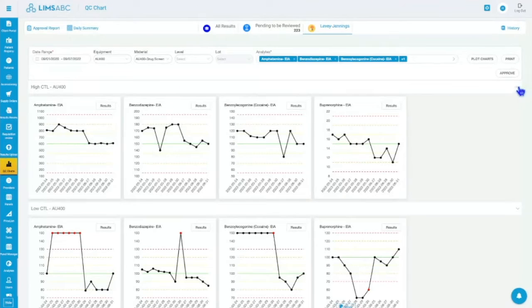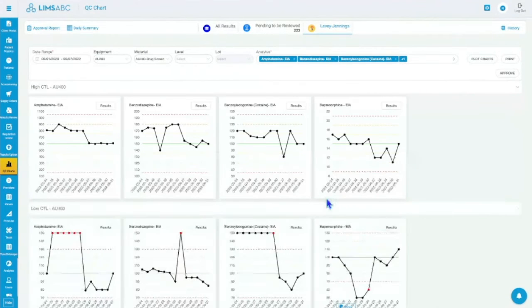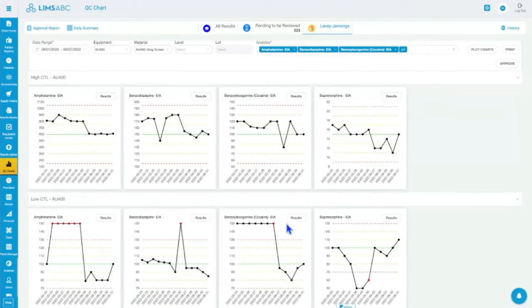So I have my 2 controls only. So for my AU, I only have a low and a high, and I can look at all of my drugs, but chemistry, everything is the same. I look at all of my targets, my analytes, and I can see the charts for them. And I can look at a glance and make sure the charts are fine. And I can see the ones with problem easily, right?